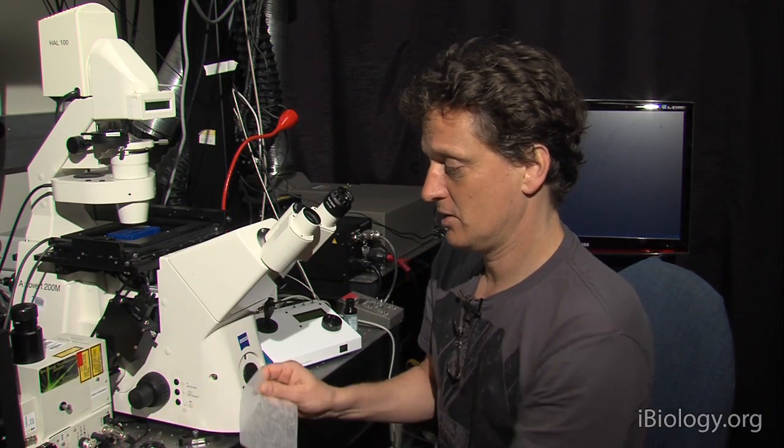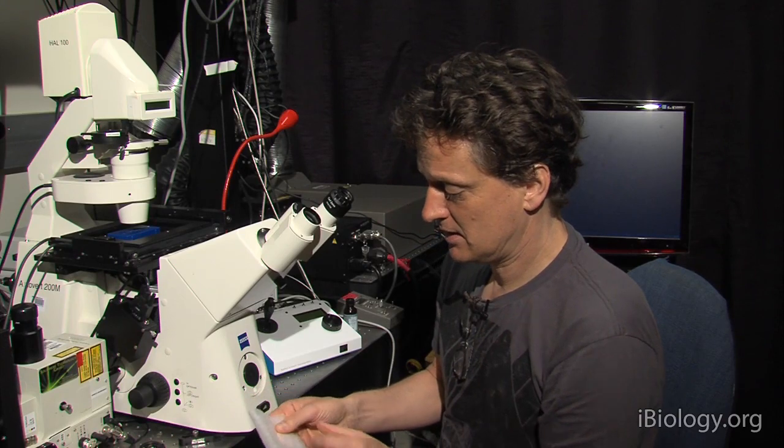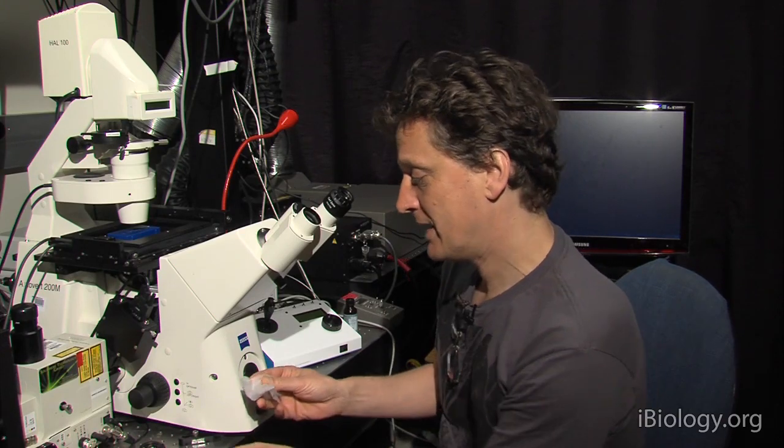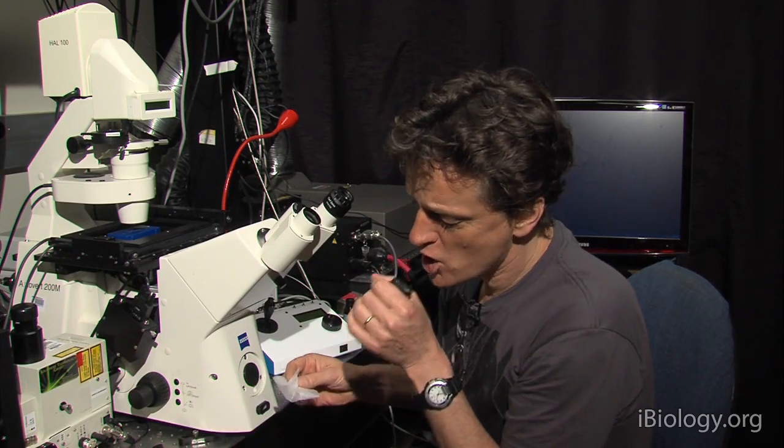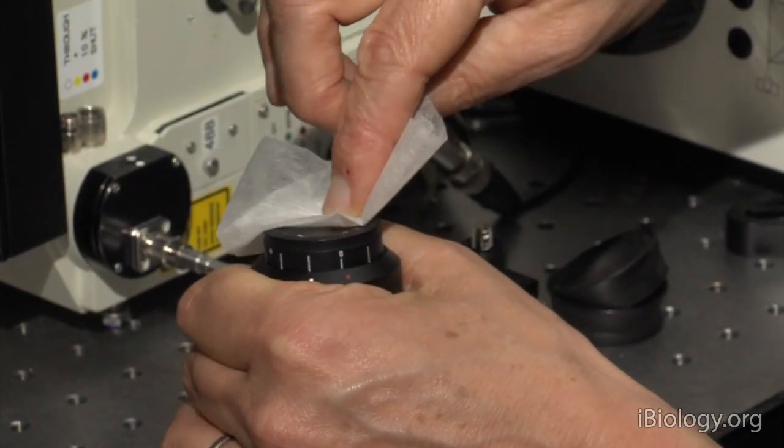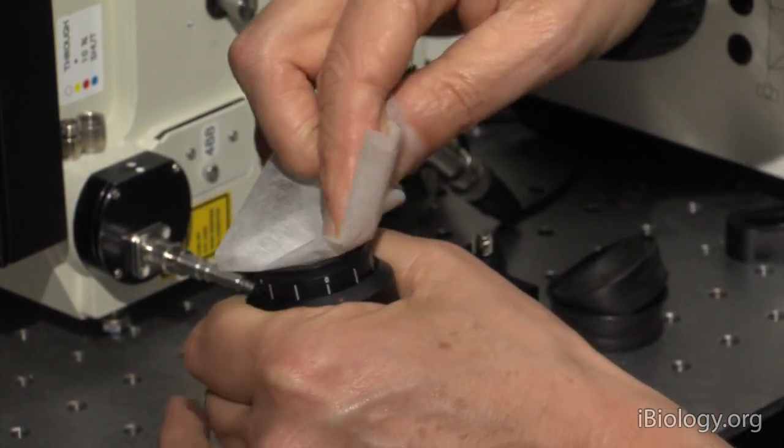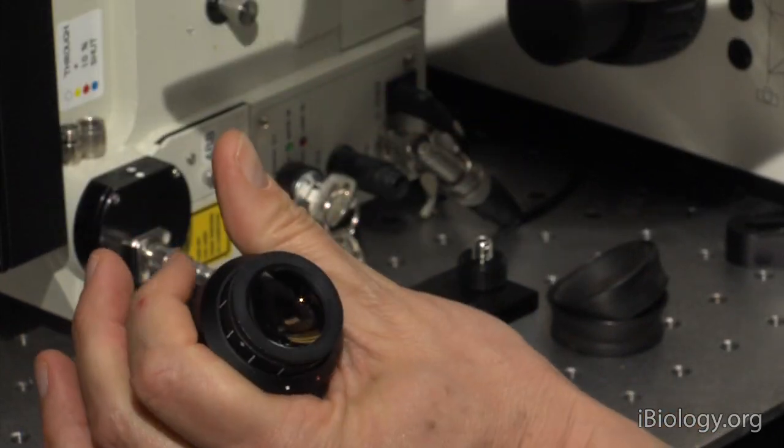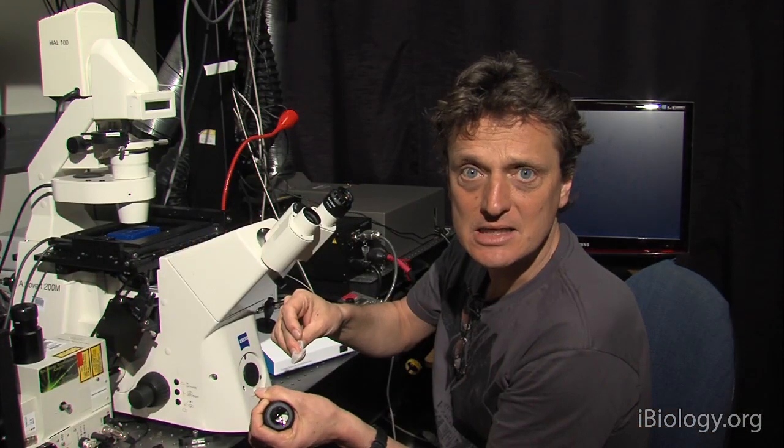And you don't have to be too anal about it, but you can just blow a little bit on them and then wipe off the dirt and just visually inspect and make sure that they're nice and clean.